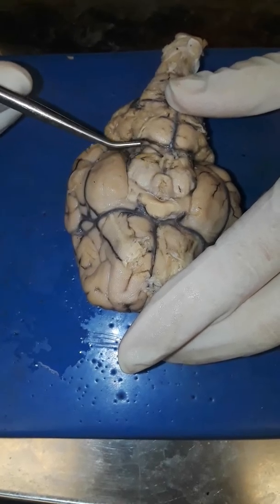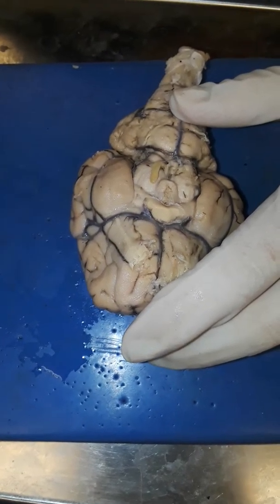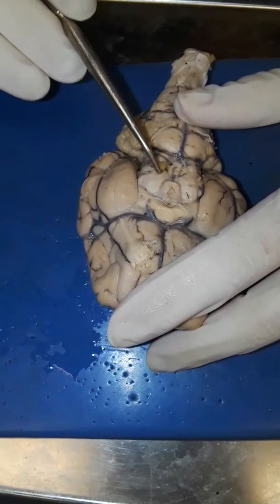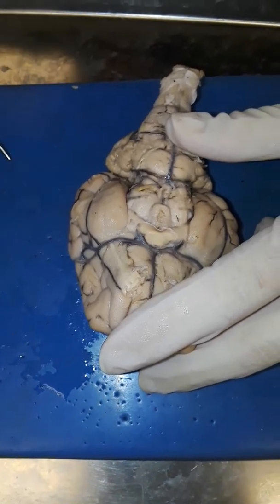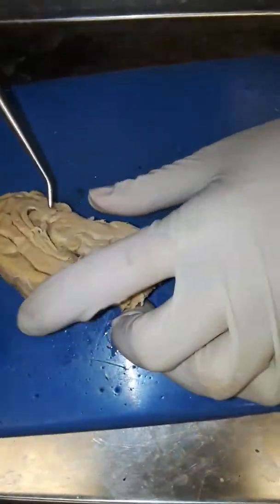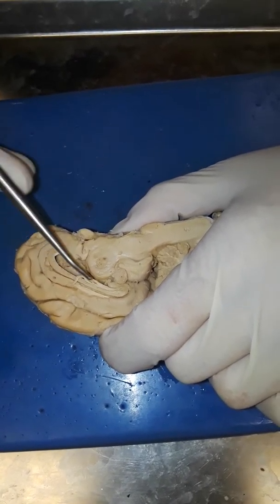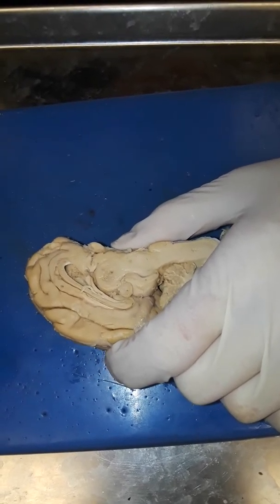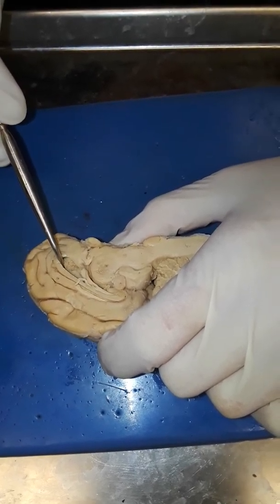The oculomotor nerve — there's one that's supposed to be here but it's not. The trochlear nerve right here, just a little bit. The pineal gland is right here. The intermediate mass is here. The lateral ventricle should be here — that hole there. And the fourth ventricle.